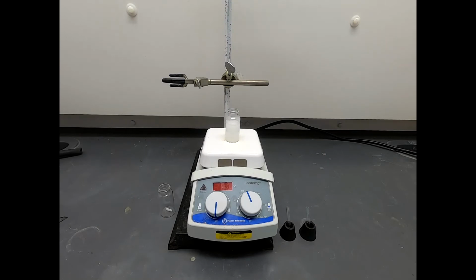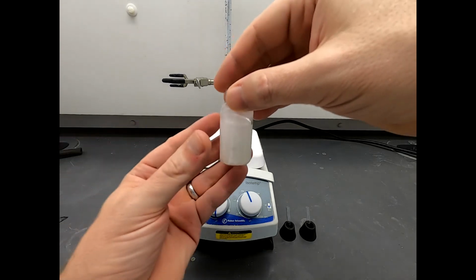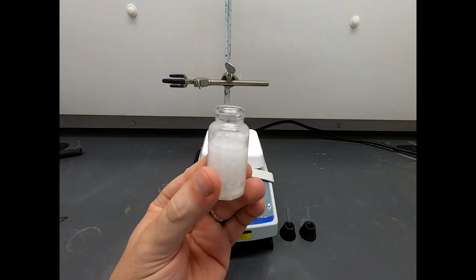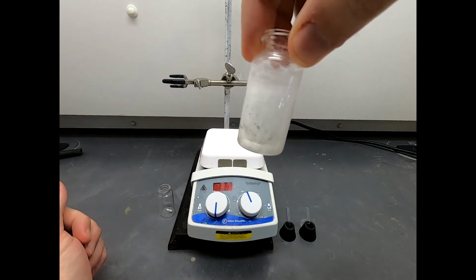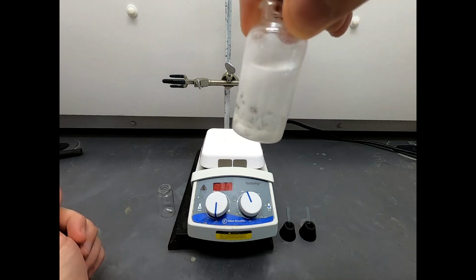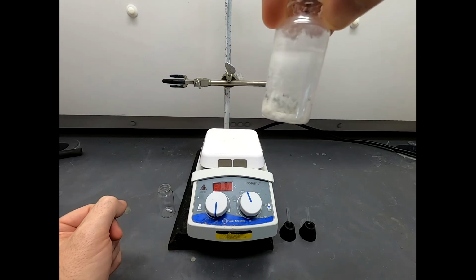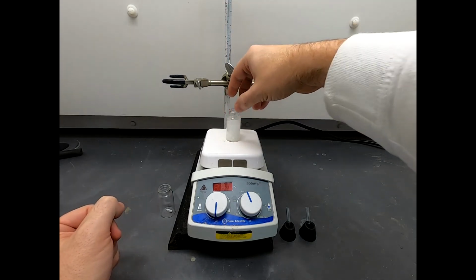Well, within no time, this actually solidified. I'd say it took maybe less than, I don't know, 1 or 2 minutes. So we'll let that stirring stop. Now, I'm not sure if that's apparent. Get my hand out from behind. That's a solution that's clear, that has solids suspended in it. That's not what it looks like to look through a glass of milk. That's definitely solids and a clear solution, and that is what we're looking for.